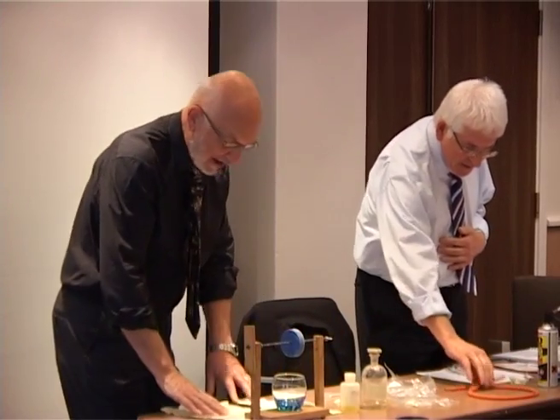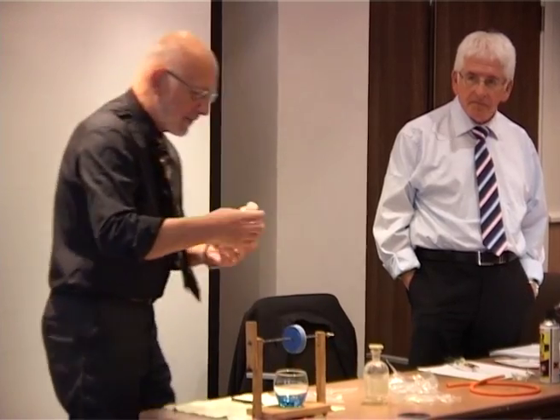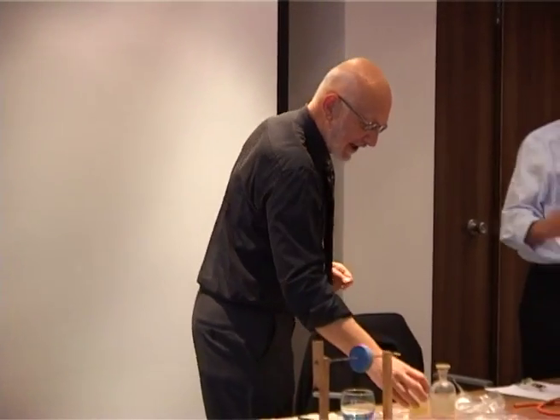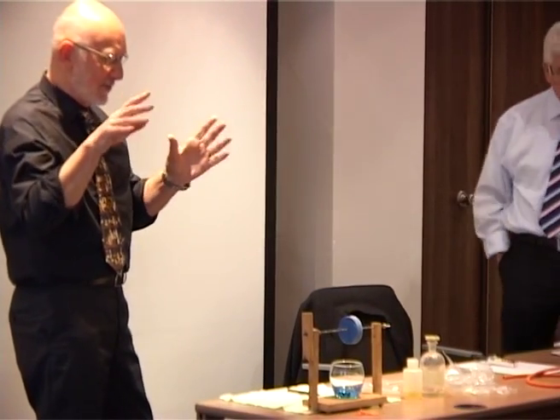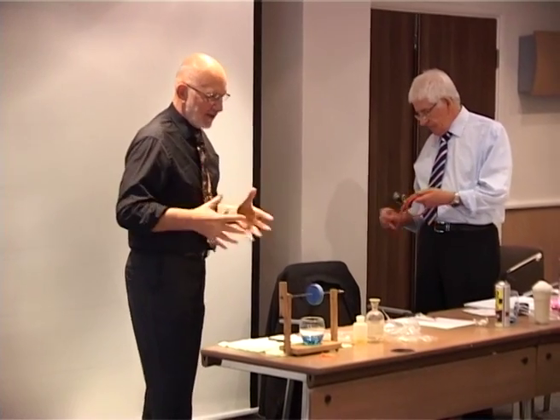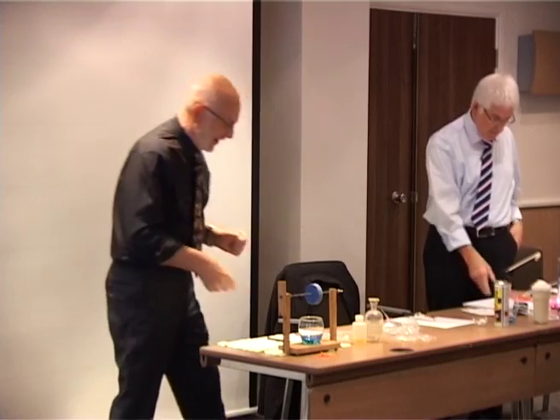I'm going to try and make a polyamide. That's the plan. And we're going to make a polyamide not with a diamine and a diacid, because that requires high temperature, over 200 degrees centigrade. I'm going to try and make it with a diamine and a diacid chloride. So instead of having COOH groups, this diacid-like species is going to have COCl. And COCl reacts much more rapidly with NH2 than does COOH.